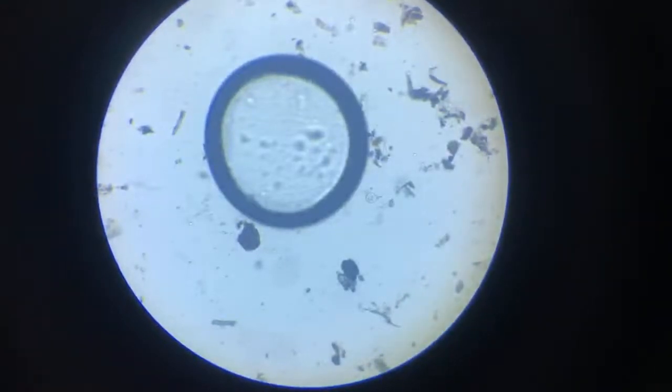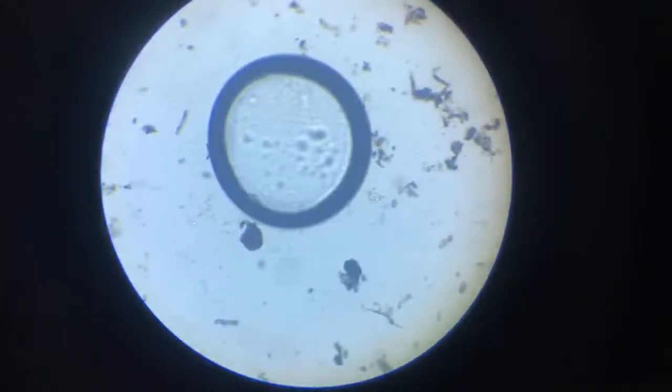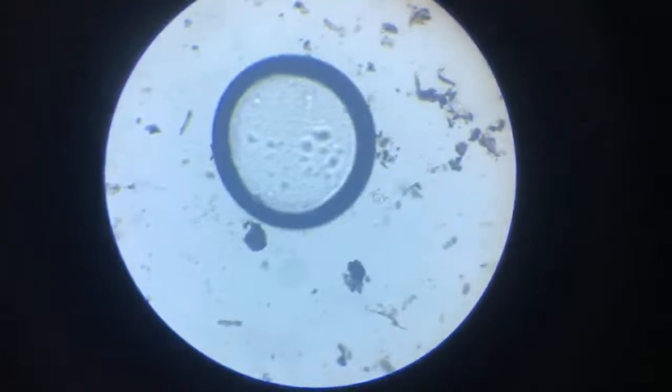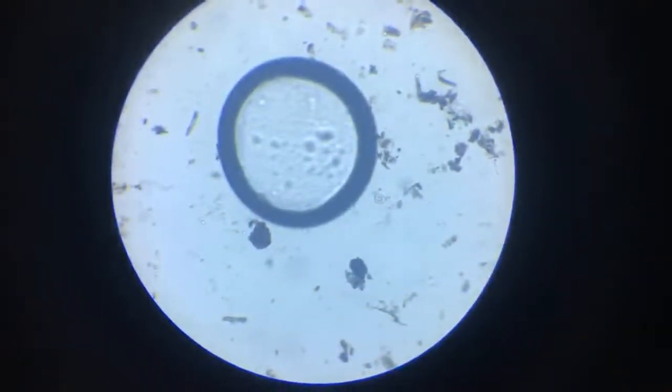All right, quite good. Not completely satisfactory, but quite good. We have some brownishness on the edge, which is something I'd trade off. And then we go for a zoom.